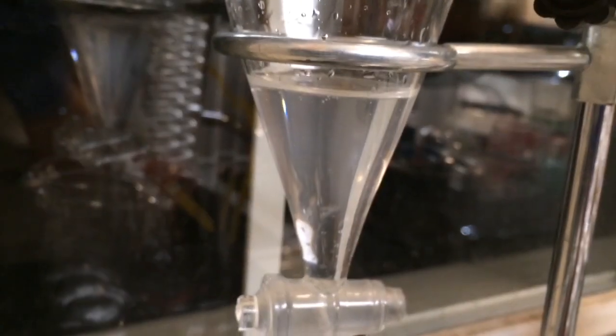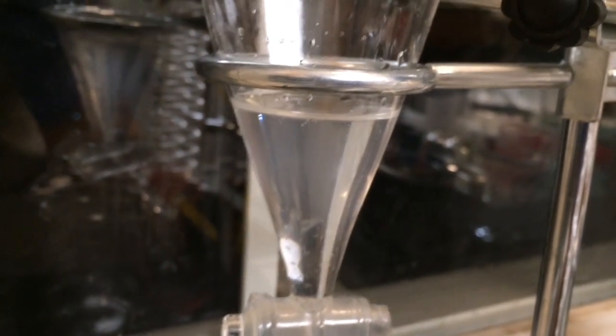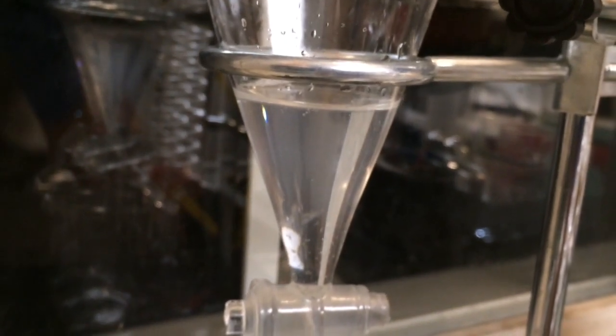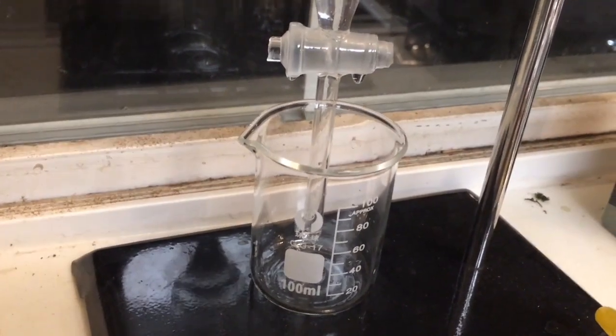So now we're just going to wait. We're going to wait maybe five minutes and just let that oil kind of collect itself. Oil is non-polar so all of the oil molecules will bind together and they'll kind of collect on that surface. Then once we've waited for about five minutes, we'll go ahead and we'll drain off the water and then we'll collect our oil.